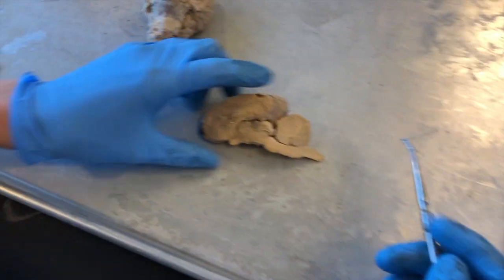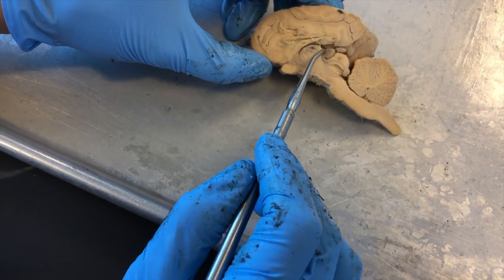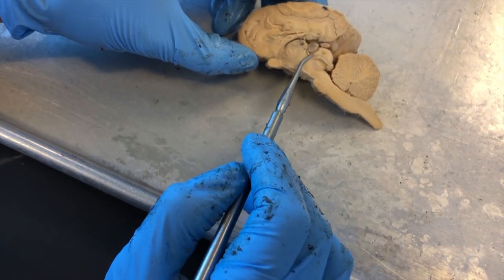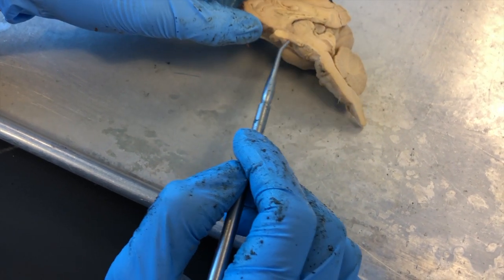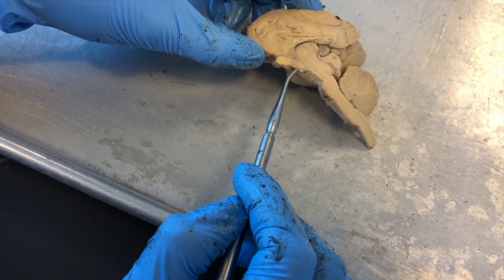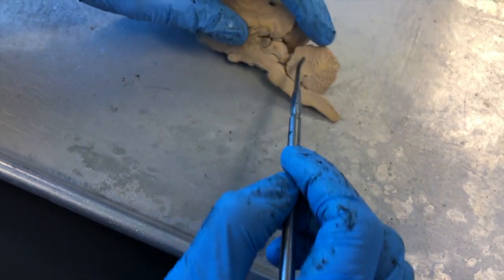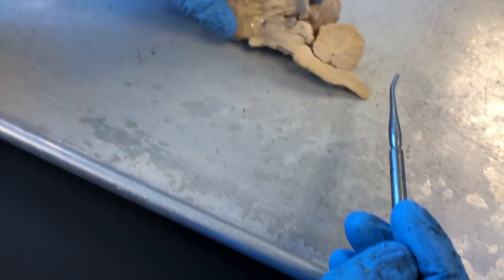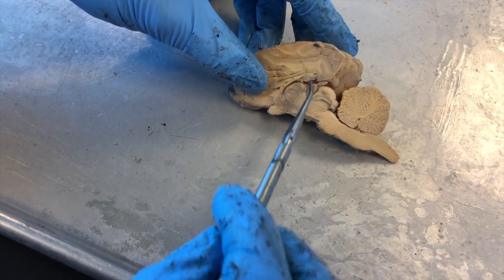Looking at the half sheep's brain from a different angle: this is your hypothalamus — that may or may not be on the lab exam. Use it as a marker to find the pituitary: go just below the hypothalamus, find the optic chiasm, and your pituitary is just there. Moving toward the cerebellum as your landmark, the pineal gland is directly inside. The three things that may be on the test: pineal gland, pituitary, and hypothalamus.